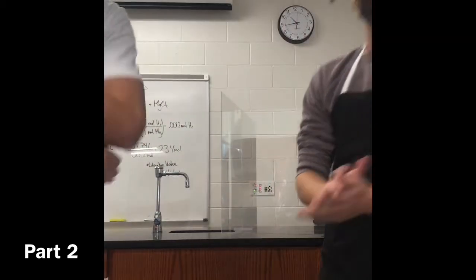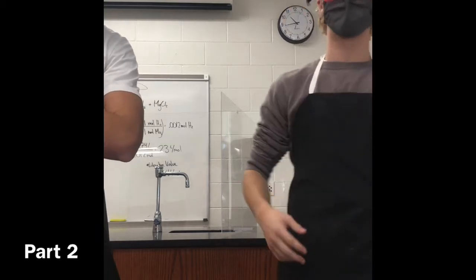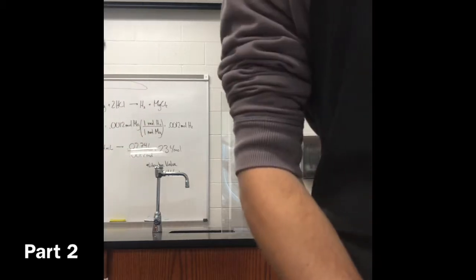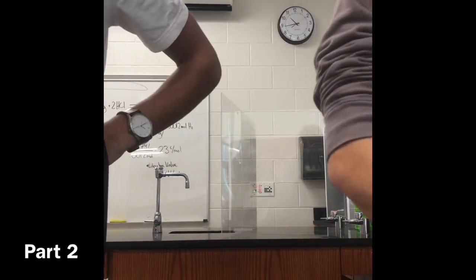Okay. Welcome to Vlog Squad 2. Let's get right into it. Okay, so here, we'll take the camera. I believe first we're going to start with NaOH and FeCl3. Let's find these things on here.